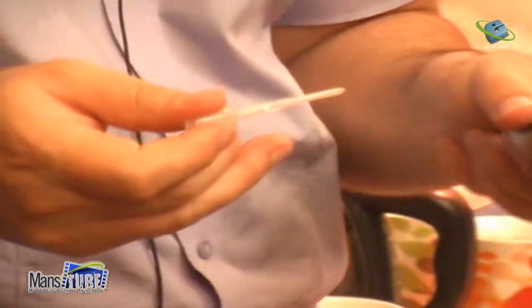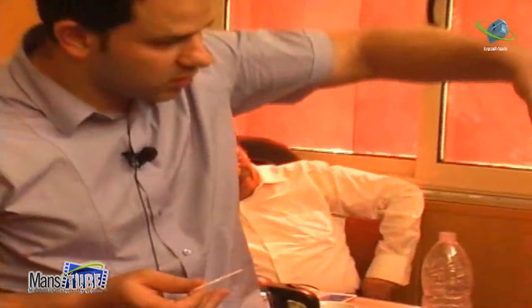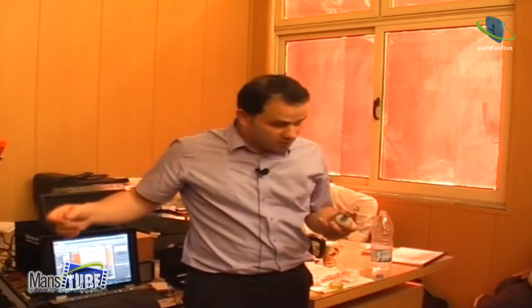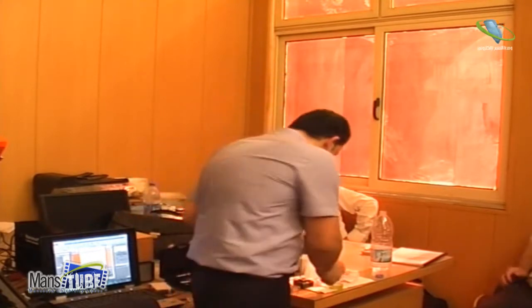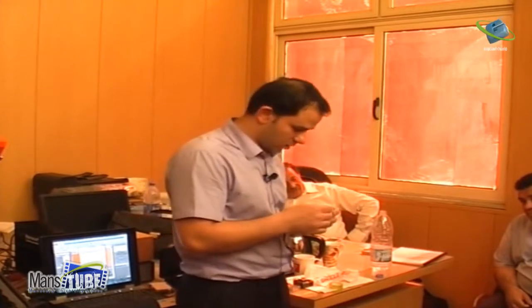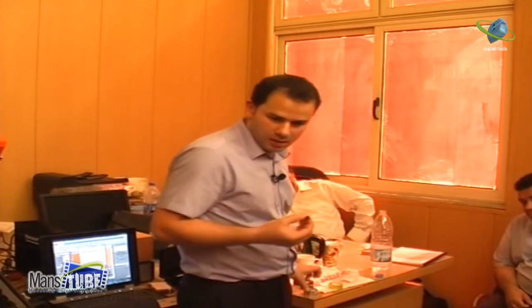Okay? So, I see there is water. You see it? Also a droplet of water. And then what I do, I will approach the other droplet to this one, and they will touch each other. Because then the cantilever is in liquid, and the sample is in liquid. So everything is in liquid. Okay? That is the idea. And if you have, I don't know, a Petri dish with full liquid, you can just immediately put it inside. Like this one, for example, we can put it immediately inside.